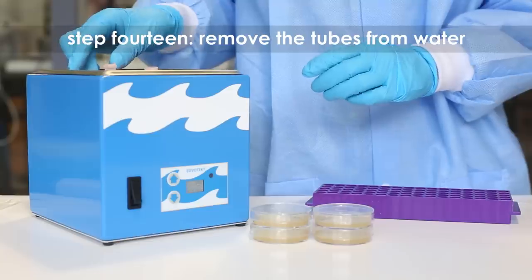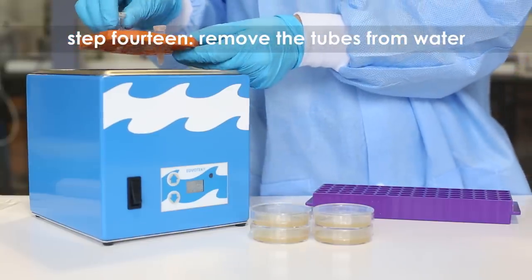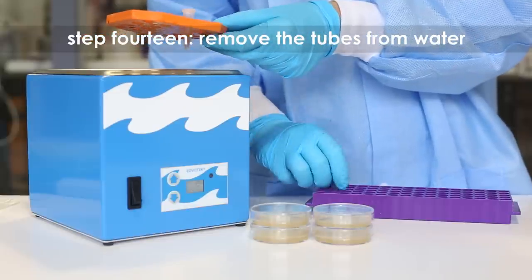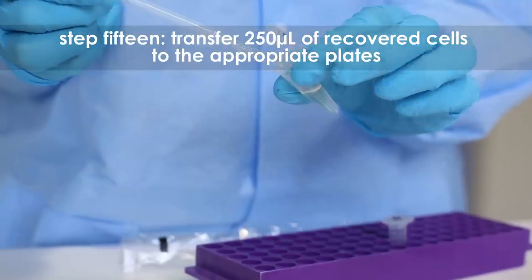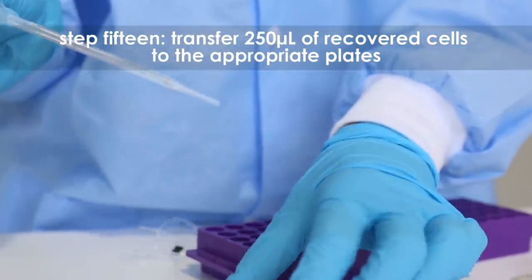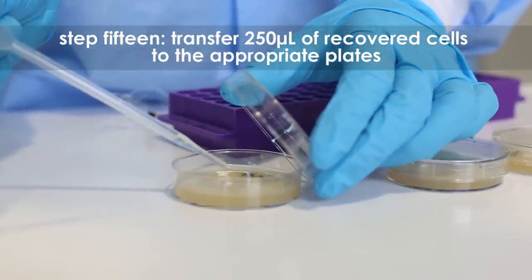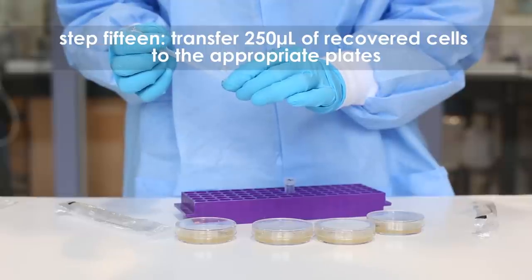Step fourteen: after the recovery period, remove the tubes from the water bath. Step fifteen: using a sterile 1 milliliter pipette, transfer 250 microliters of the recovered cells to the appropriate plates.